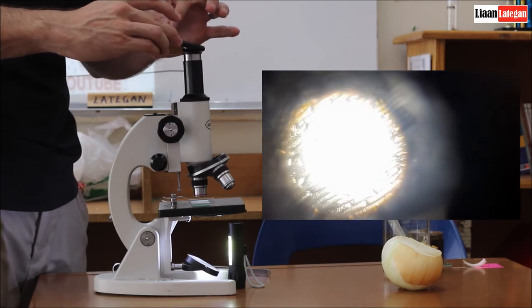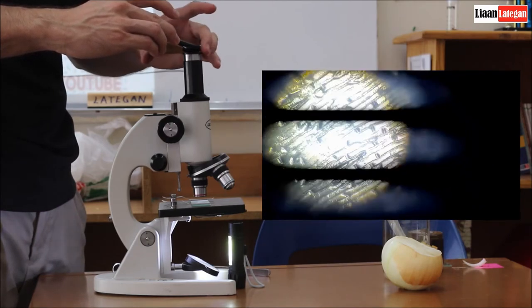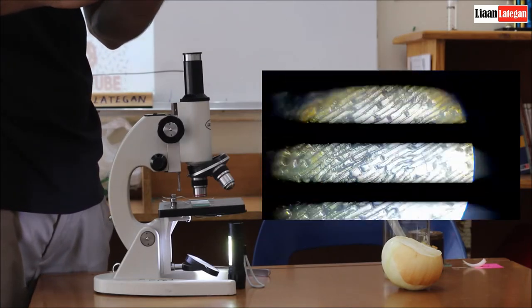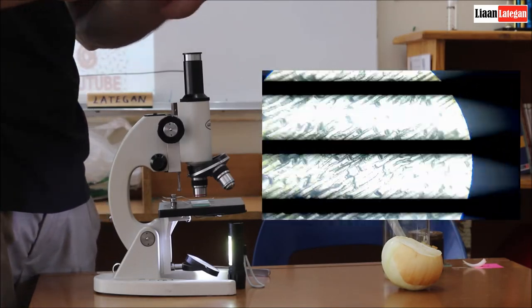So if you want to do the same, you can. Zoom in slightly. And a little bit closer.